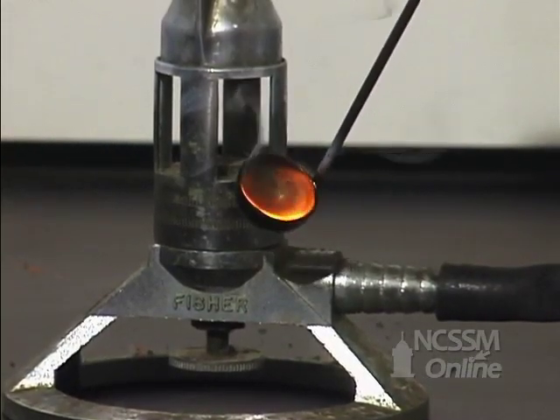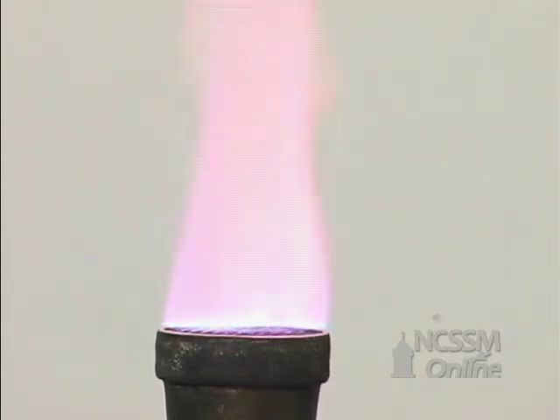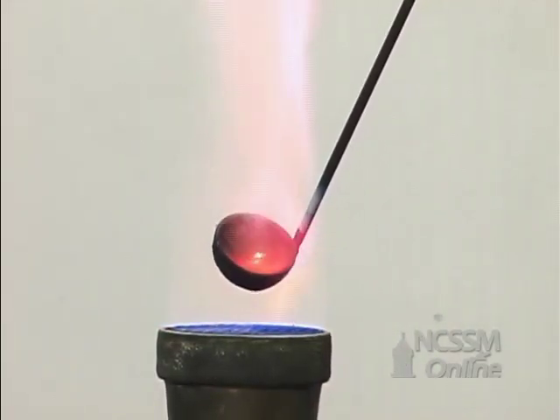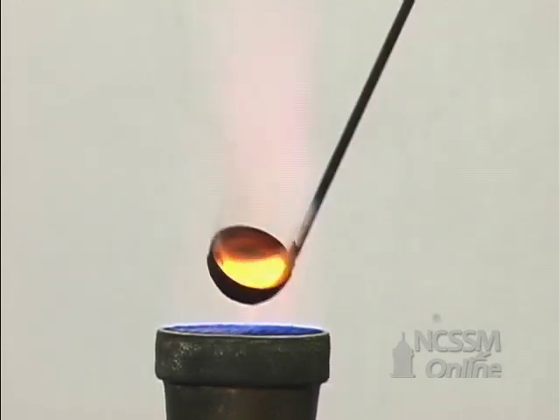Potassium ions give a characteristic lavender color to the flame. The potassium reacts with the oxygen in the air to form the superoxide.